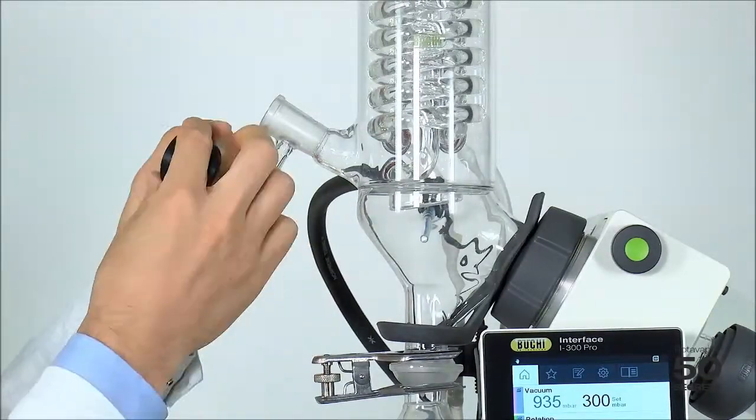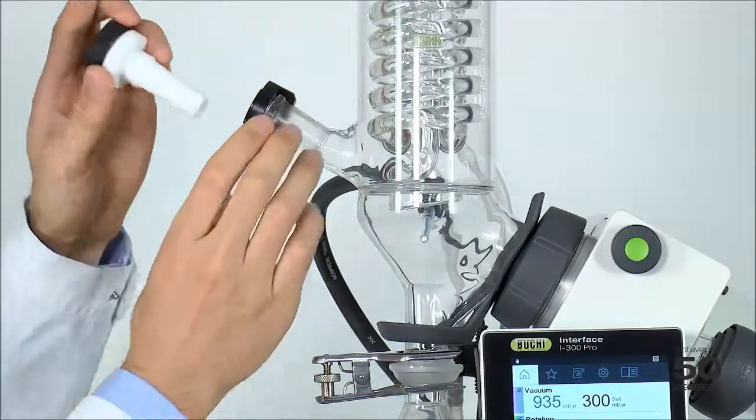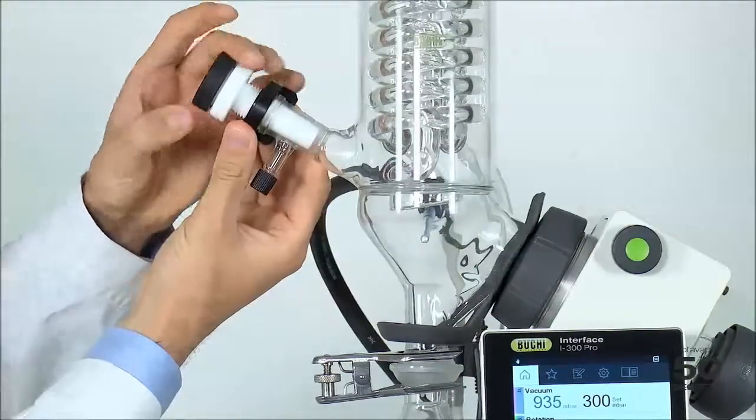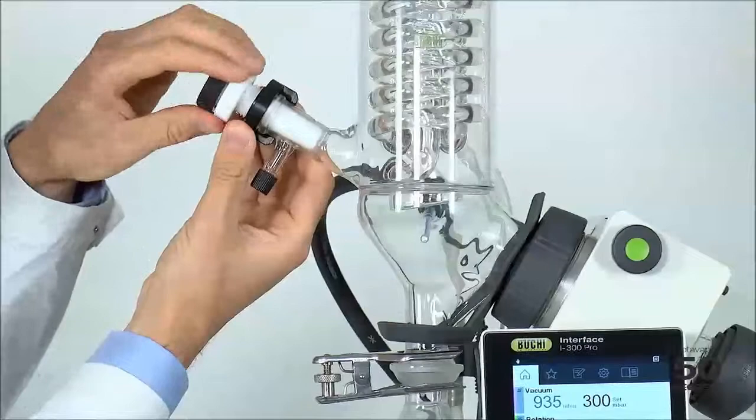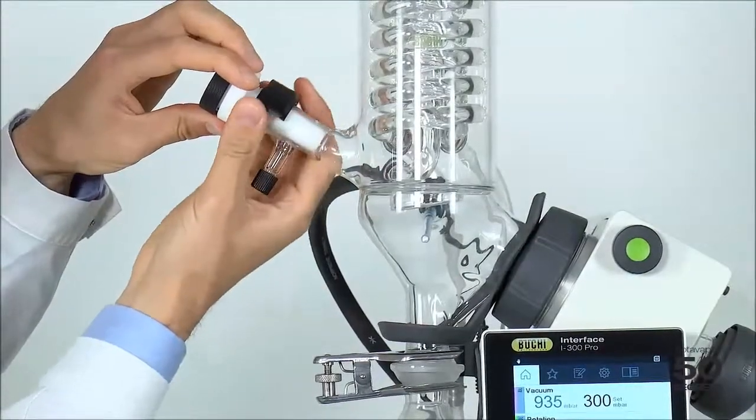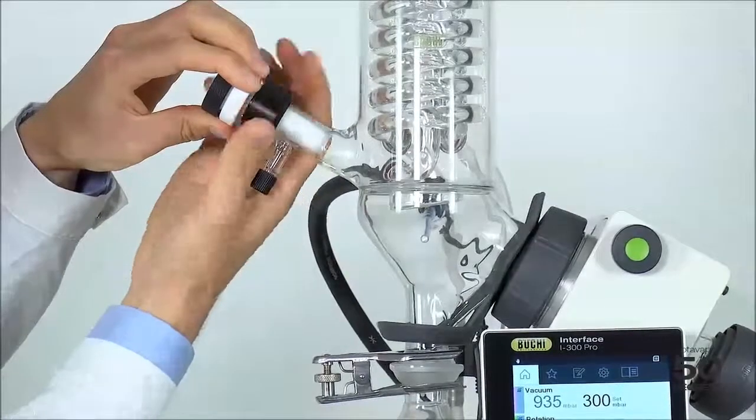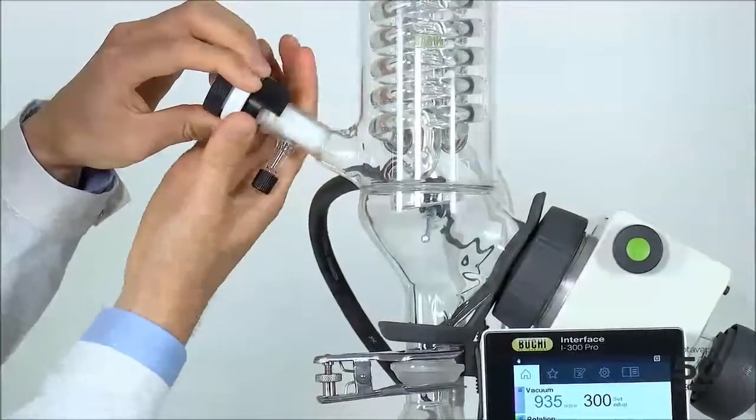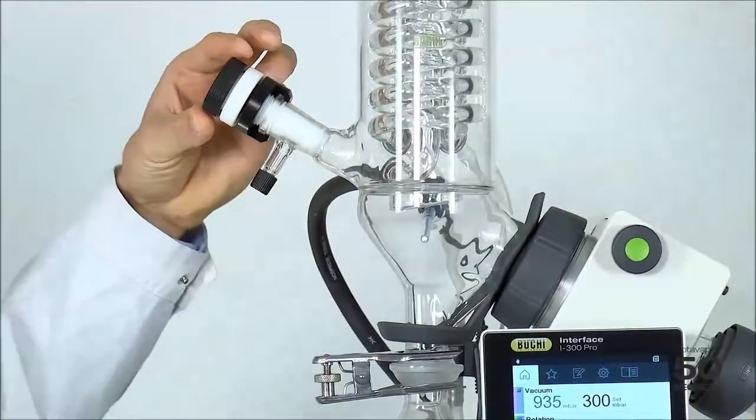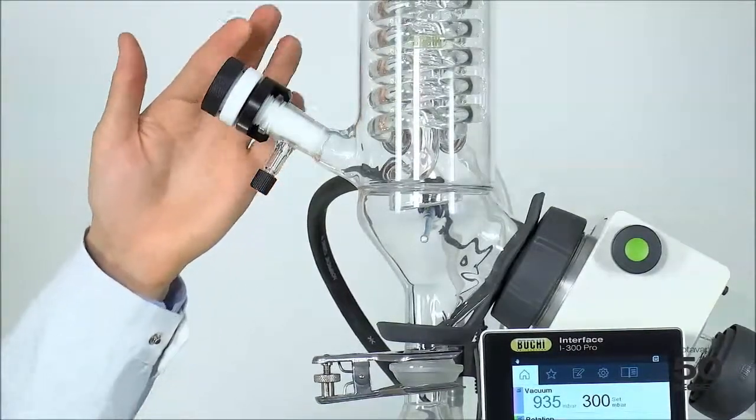We open this one up, we put it like this and we screw this part in like that. We make sure it's tightly fixed like this and we open this back end like that.